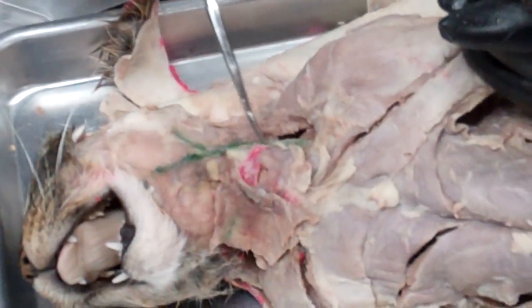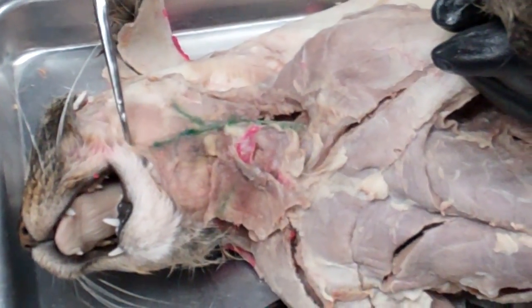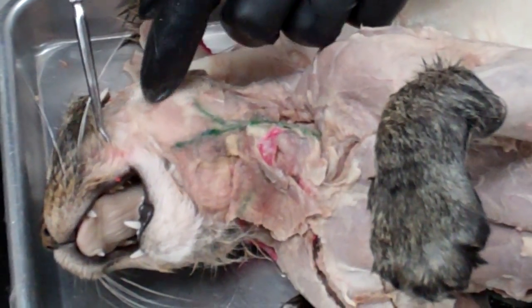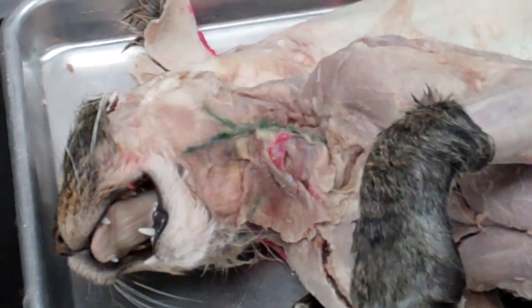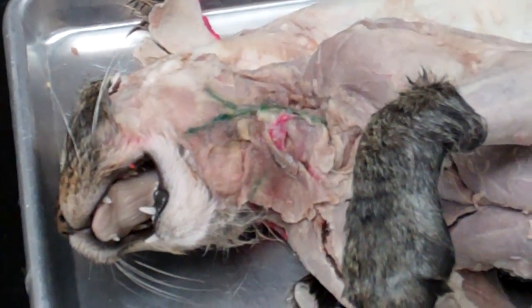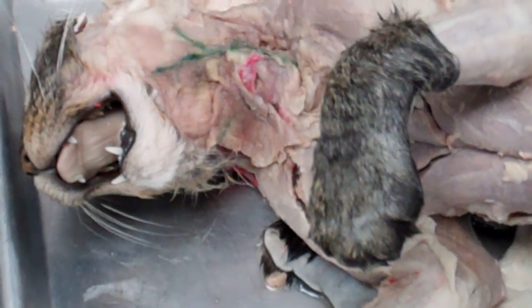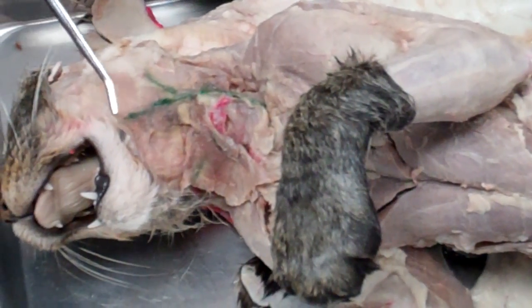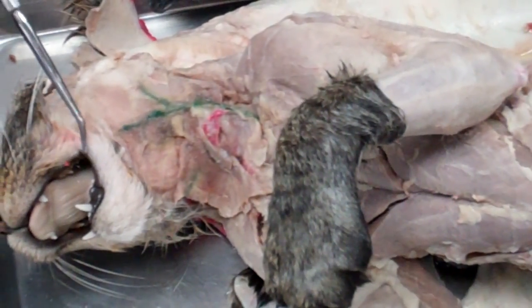This is the jugular vein, and this branch is the anterior facial vein, which goes up to the molar gland. The molar gland is right here in the crook of the mouth — you can identify a gland by its lumpy, consistency similar to a pea. Your anterior facial vein should be going right up to the bottom edge of the molar gland, at the corner where the two lips come together.